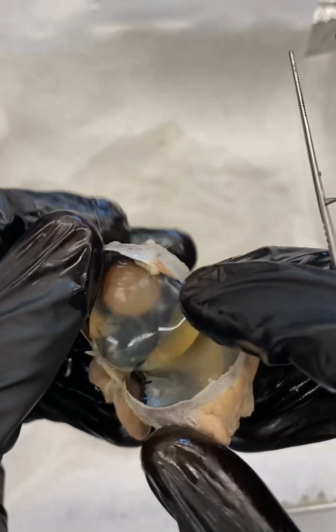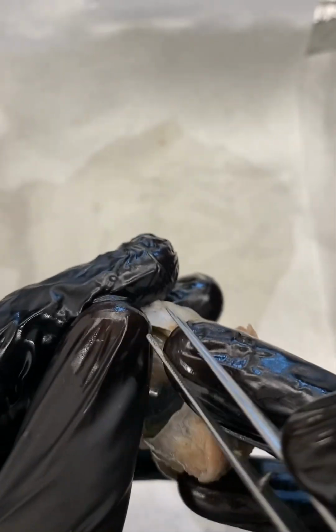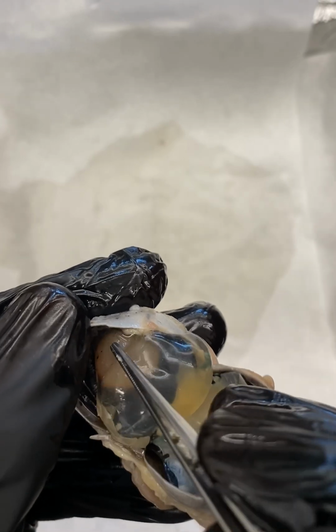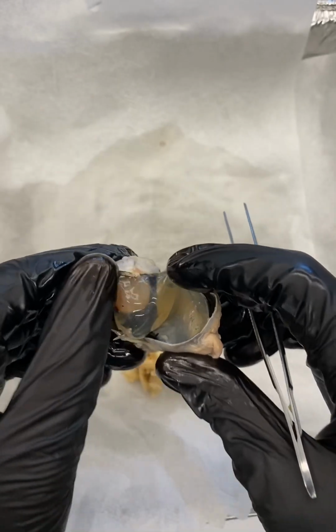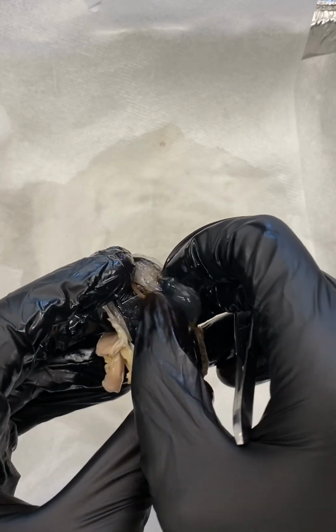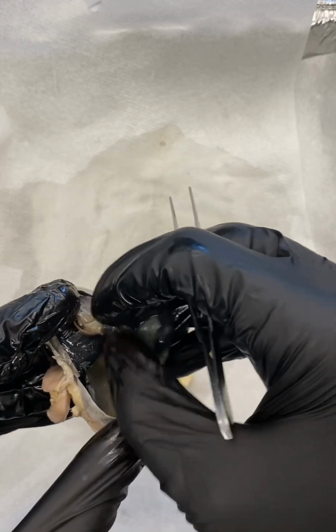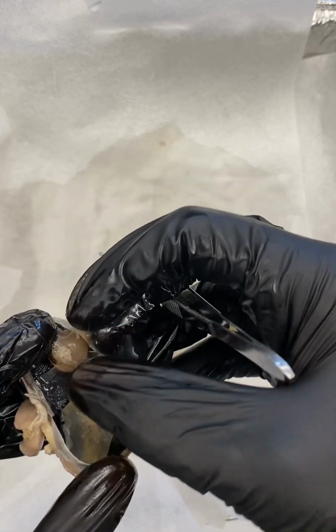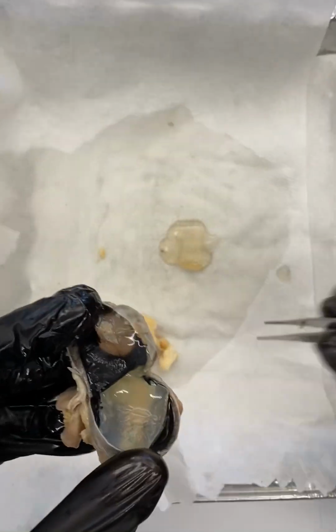And then it's also helping to keep this circular structure that you can kind of see here, hopefully at the tip of my pointer through this gelatinous material. This structure here is the lens. So it's also helping to keep the lens pressed up against the eye. What we can do is take this vitreous humor and peel it and remove it, and we'll set it aside for the time being. It's pretty soft here, so we can just pinch it and peel it and remove it. You can see it there very nicely, kind of Jell-O-like consistency.